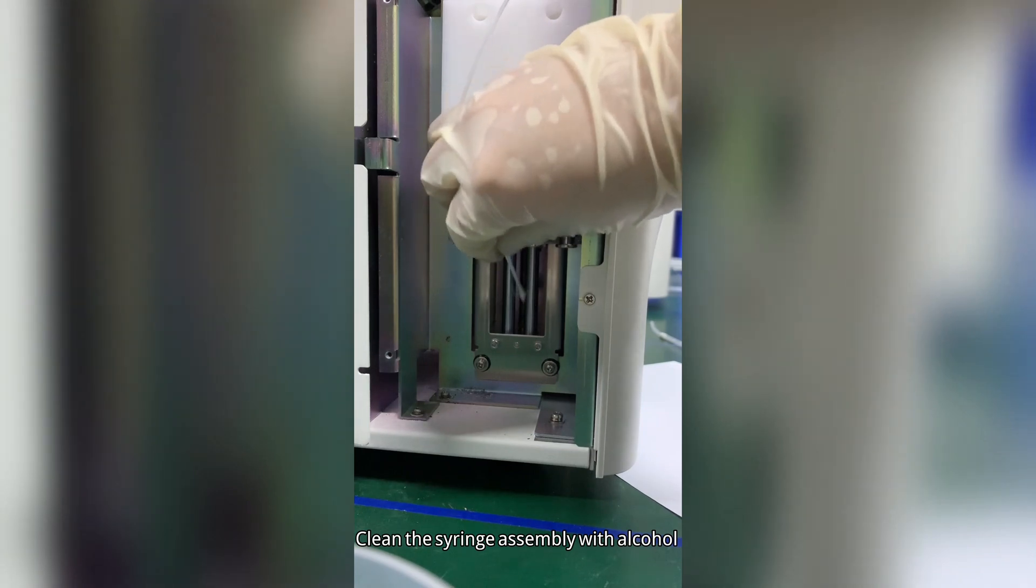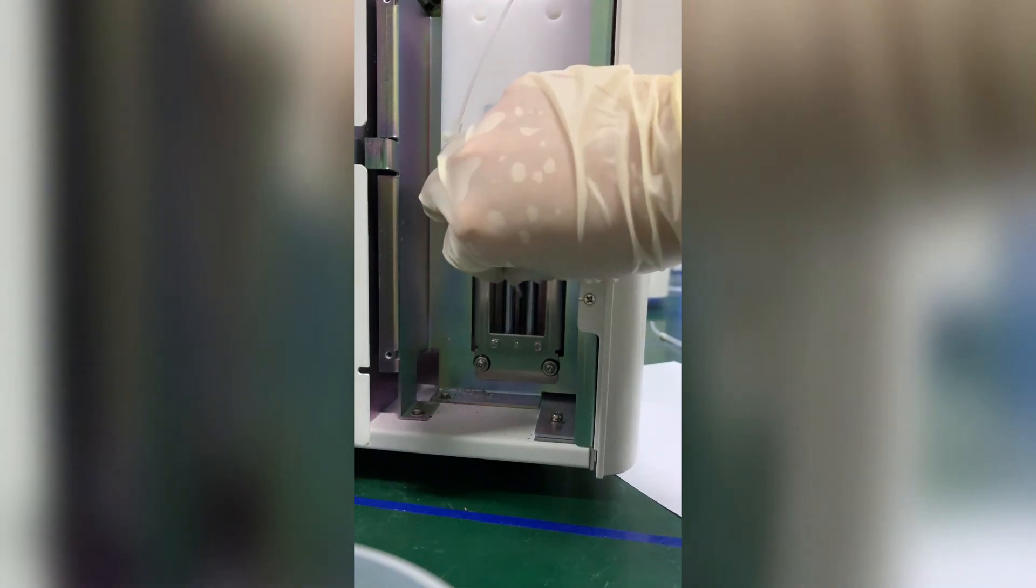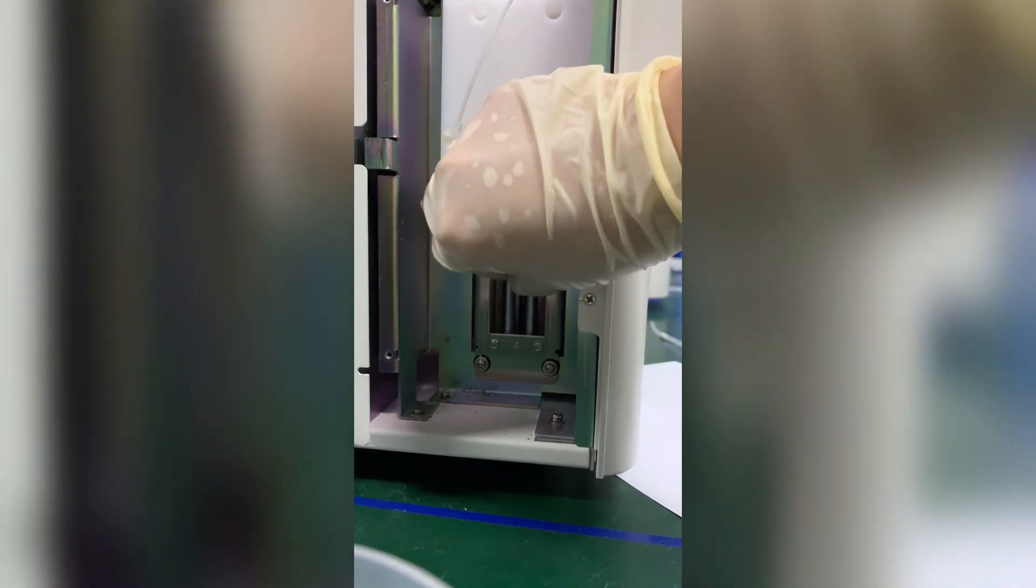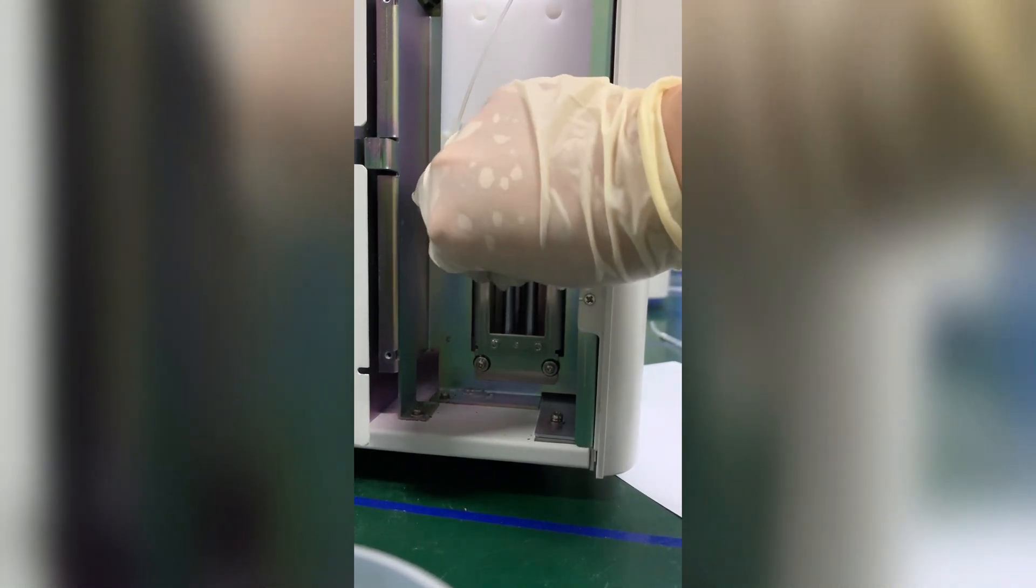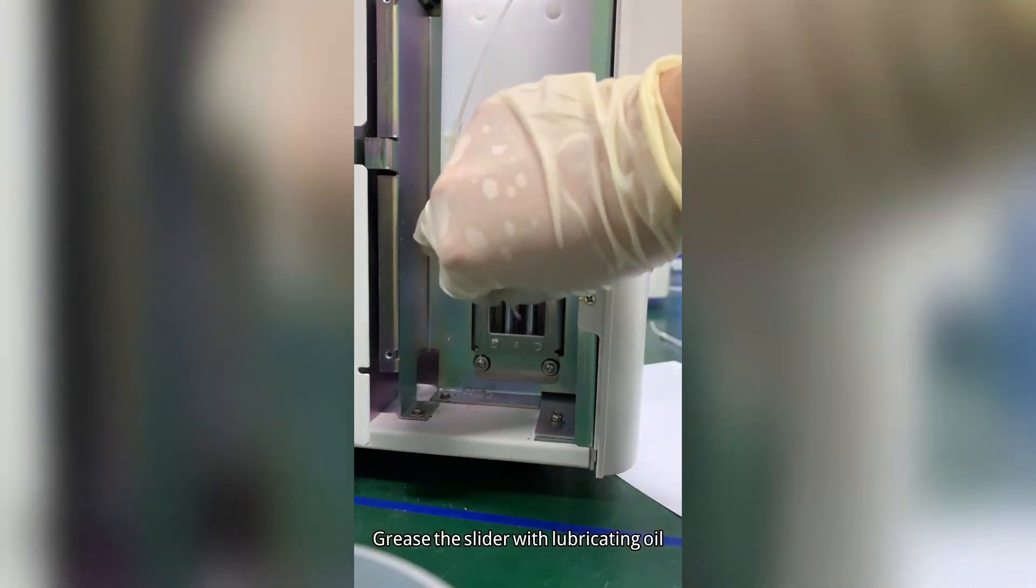Clean the syringe assembly with alcohol. Grease the slider with lubricating oil.